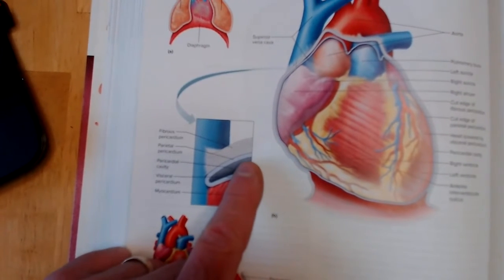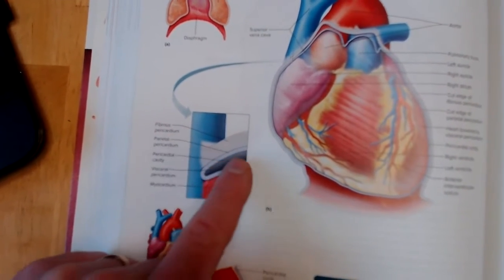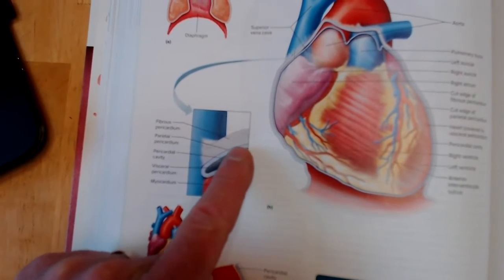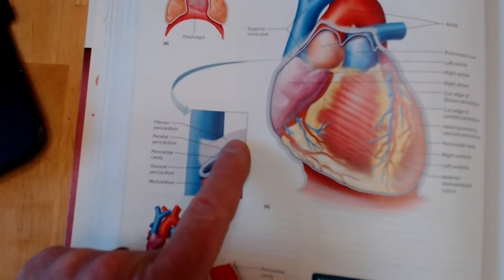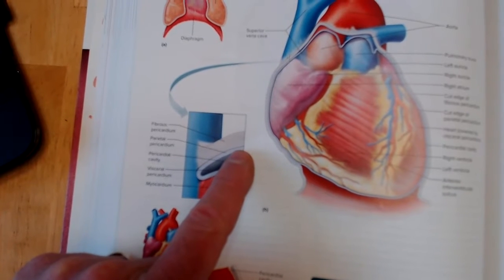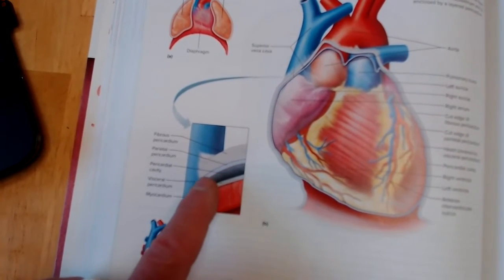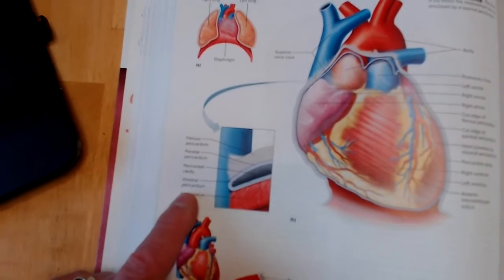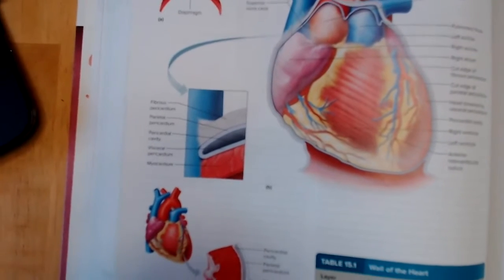So you're going to see this somewhat thick, semi-transparent fibrous pericardium on the surface of the heart. And I want you to note that on the very inner surface of the fibrous pericardium is something called the parietal pericardium. So that's this structure right here. So this is on the inside of the fibrous pericardium, the sac. It's a very thin membrane, the parietal. And then that parietal pericardium will fold back upon itself to form the visceral pericardium. And we said that the visceral membranes are those that cover the surface of the organ.